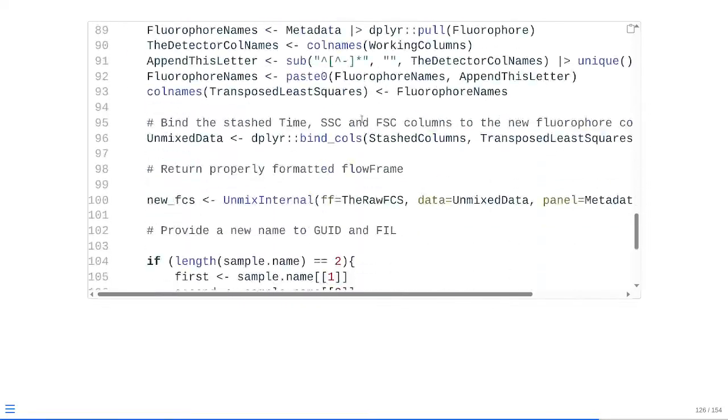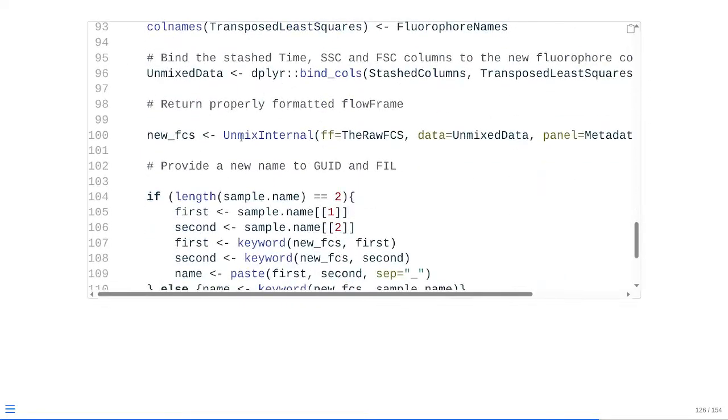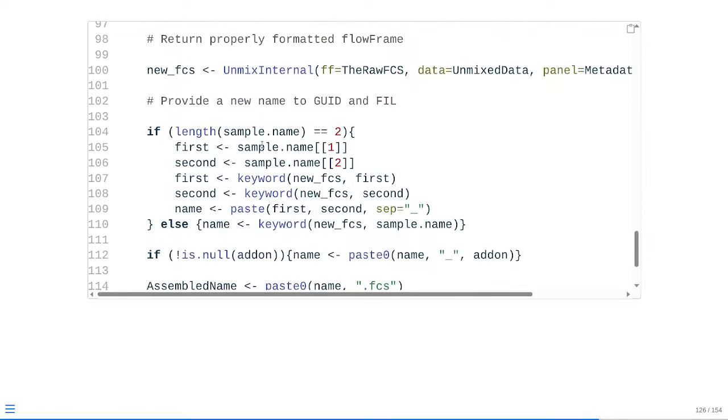And as we scroll down to the bottom, right after we've unmixed, right after we got back the properly formatted flow frame, at this point, we can set up the conditional depending on if the argument we're passing to sample name corresponds to just one keyword or if it corresponds to two. So let's say we're only wanting to rename the file based on group name. That's just going to be sample name is going to be a length of 1, so this is going to be evaluated as false. It's going to jump down to the else, at which point keyword is run on the flow frame, and it grabs for that particular keyword name, and that's what the name is going to be later on in the future.